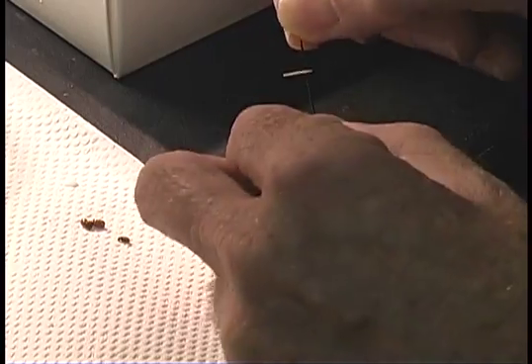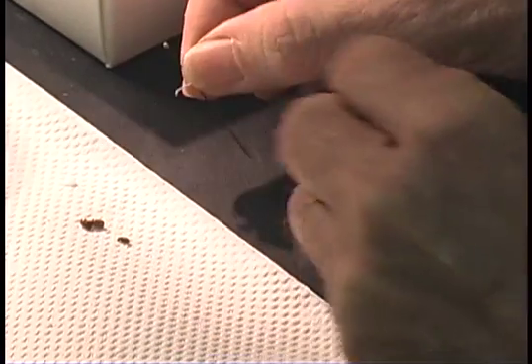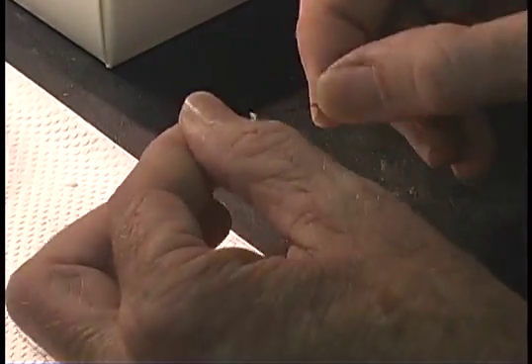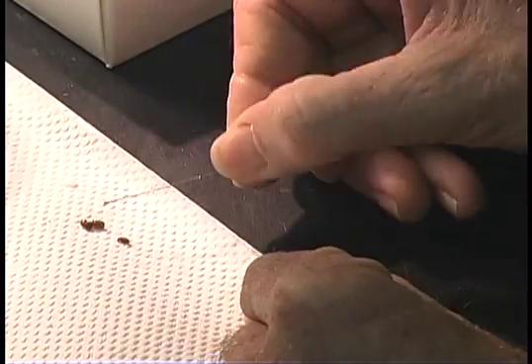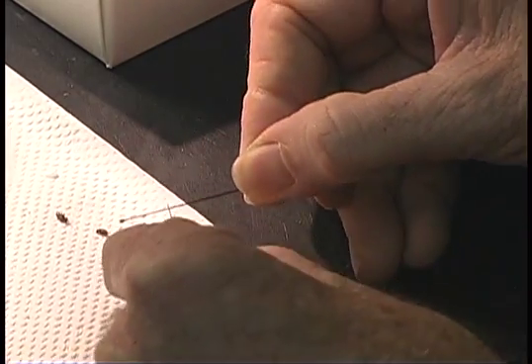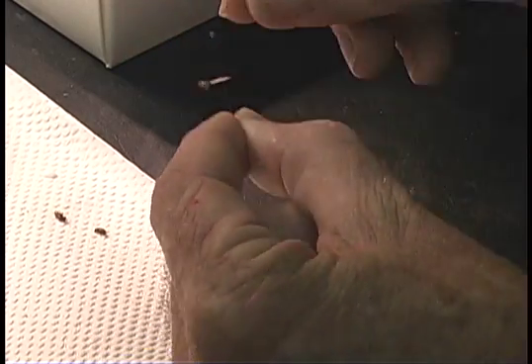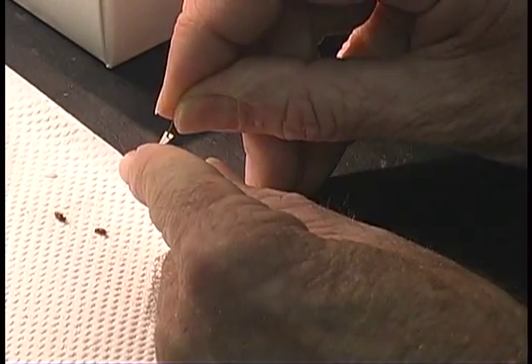One more time. Hold the point. Modify the tip. Pick up a little glue. Pick out your target. Apply the glue, the tip of the point, to the appropriate place on the insect's body. Then bump him into position.